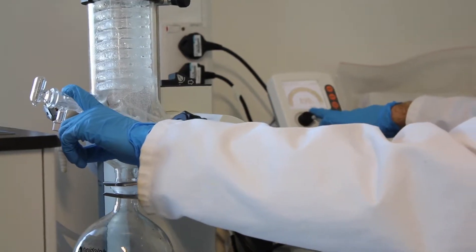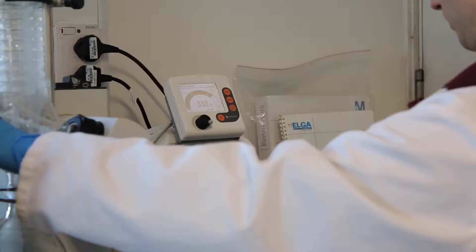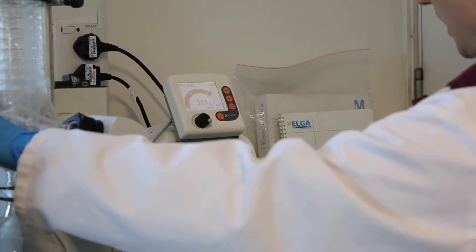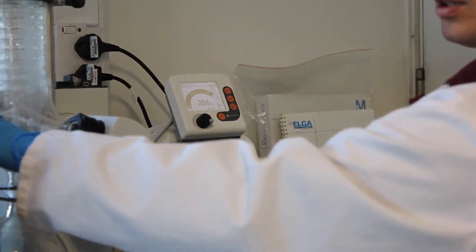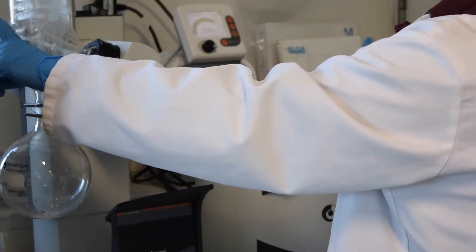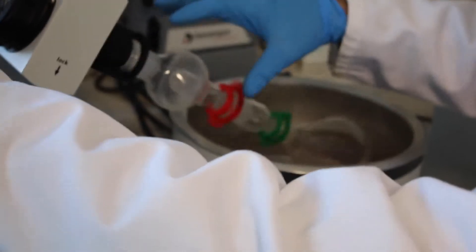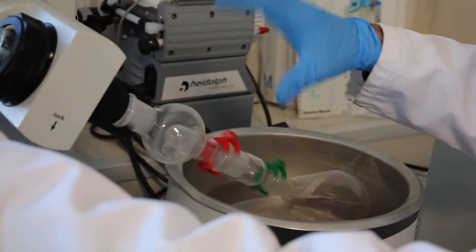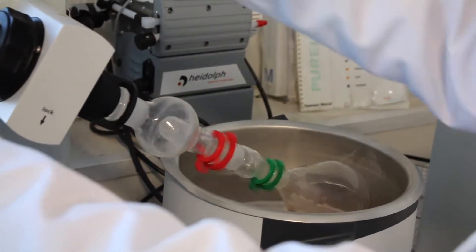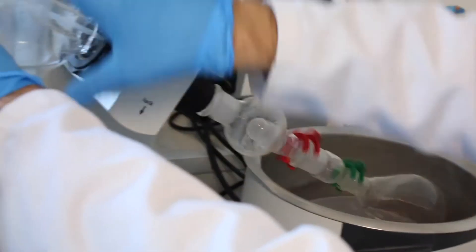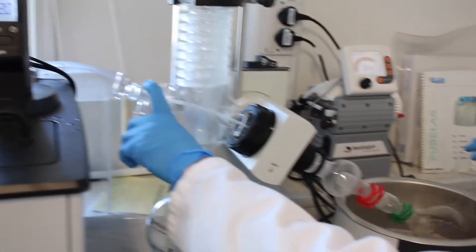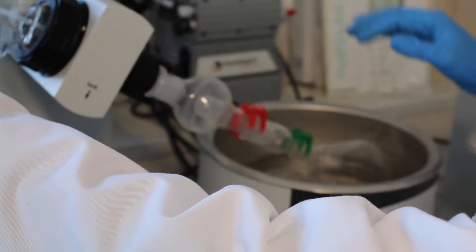You can see the pressure here in this display. You want to keep an eye on your solvent here. You don't want that to bubble too vigorously because otherwise the vacuum can suck it in. But that's why we have this splash guard here to prevent any solvent from directly entering the main chamber of the rotary evaporator.